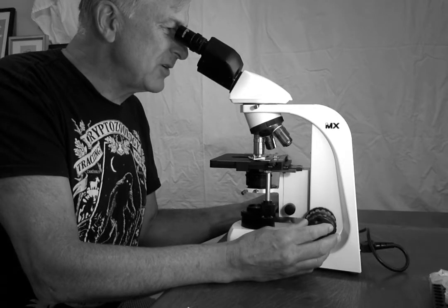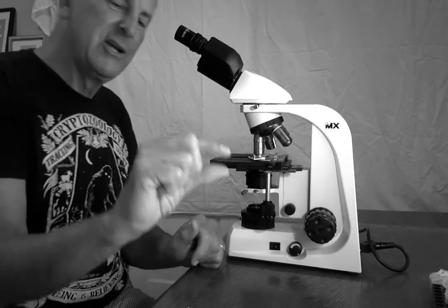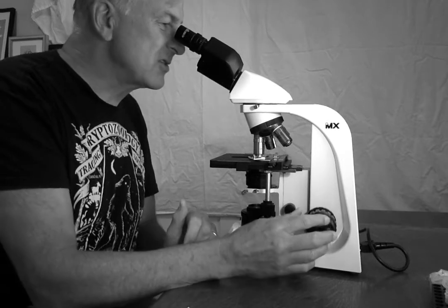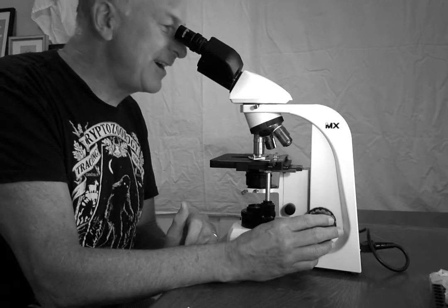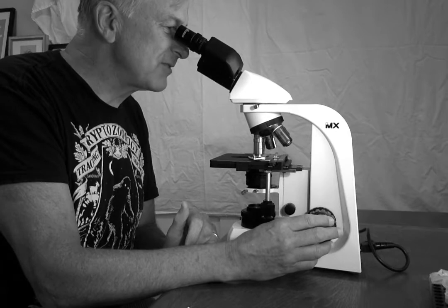But the other thing you will notice is now your depth of field has shrunk significantly, meaning only little layers are in focus. So to see different things, I will play with the fine focus knob, and that might bring different features in focus.